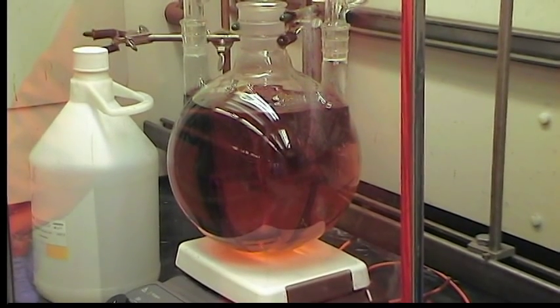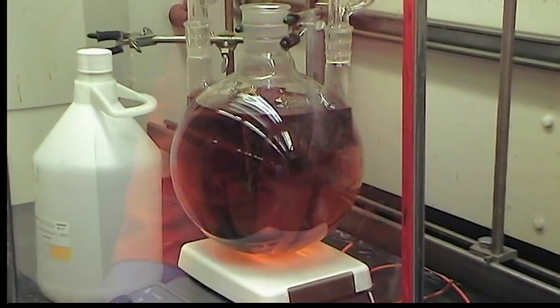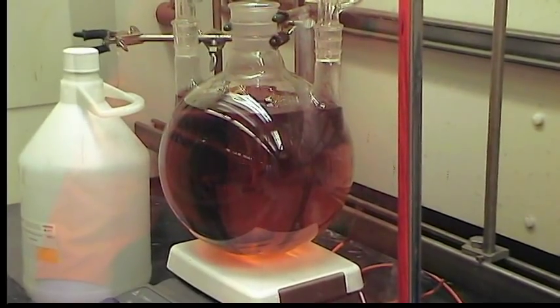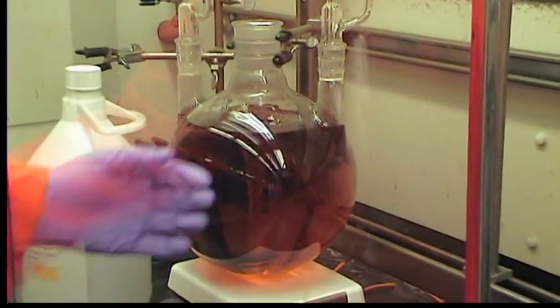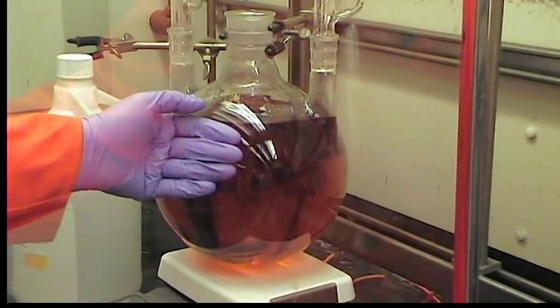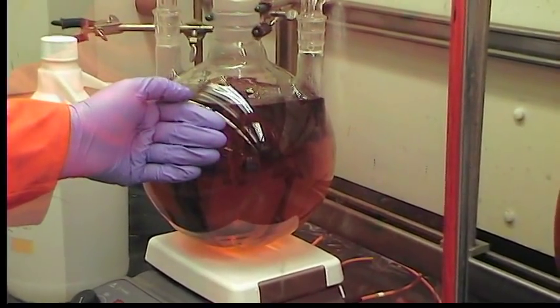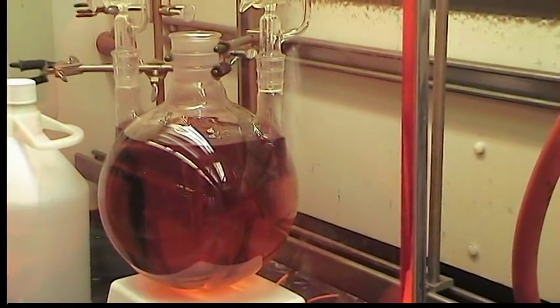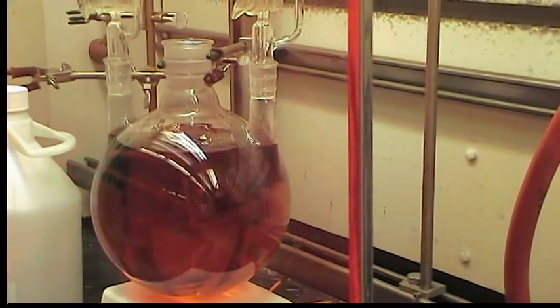We've been adding the acid for about 2 minutes now and the color as you can see is red. The temperature of the mixture is already significantly hot, approaching 90 degrees. We're going to let this continue and come back later.